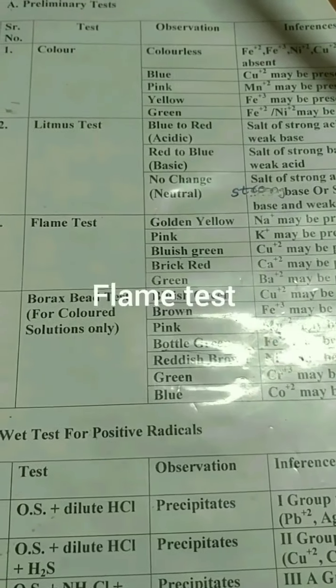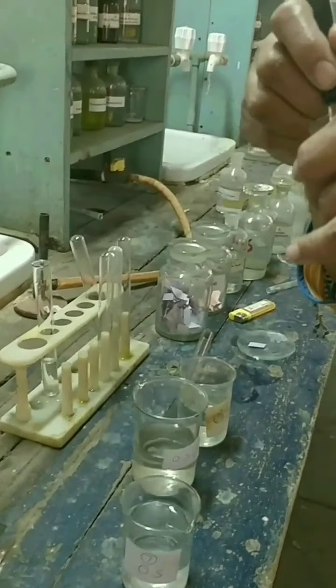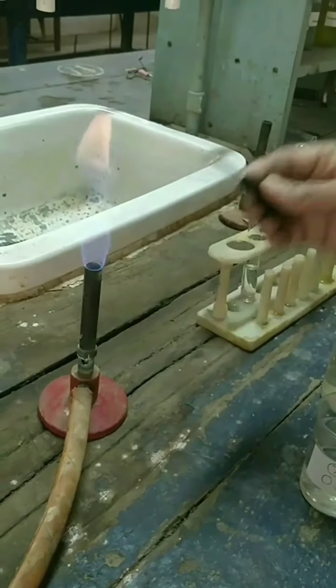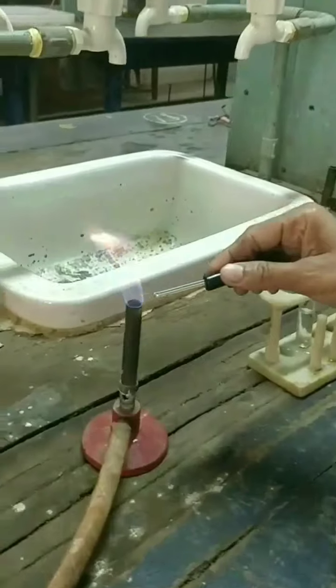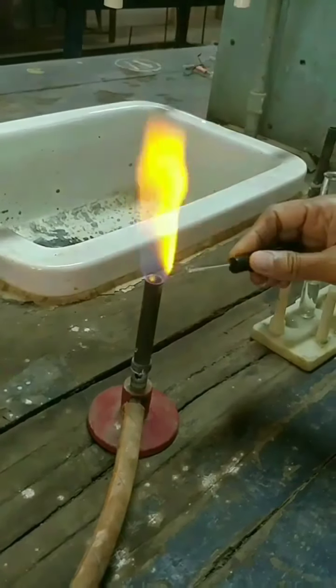Flame test. For this we need platinum wire. So before doing this flame test we need to clean this wire. So for cleaning you will dip this wire into concentrated HCl and you will heat it continuously.